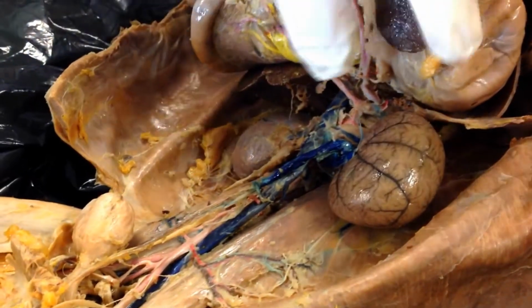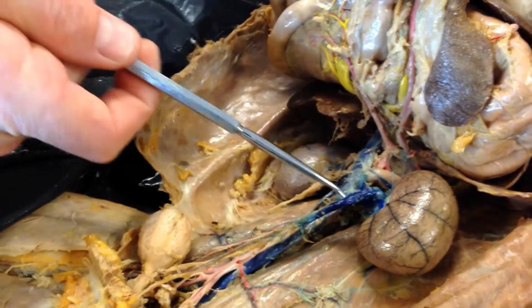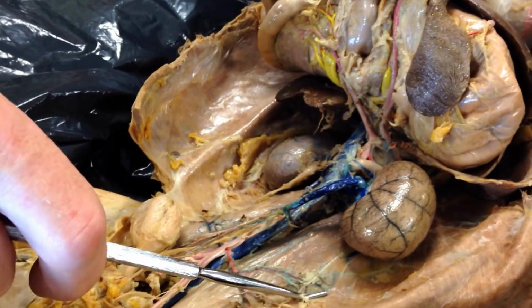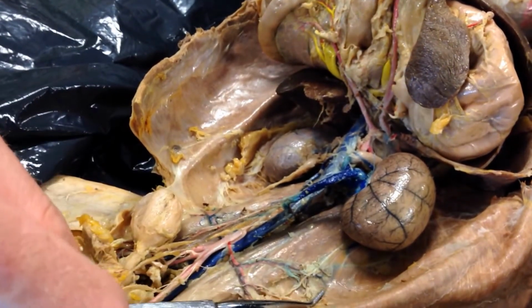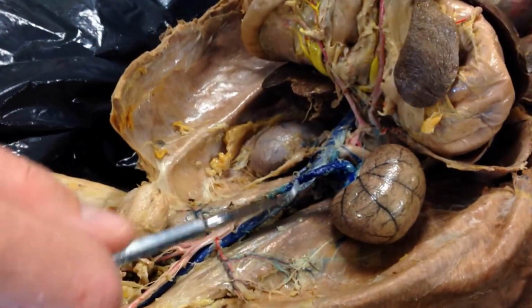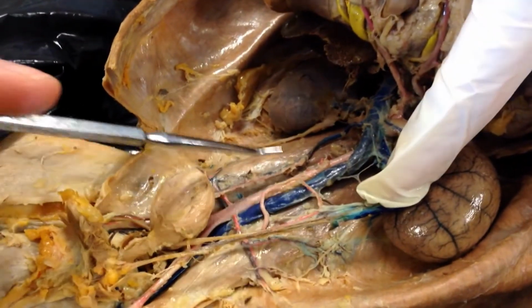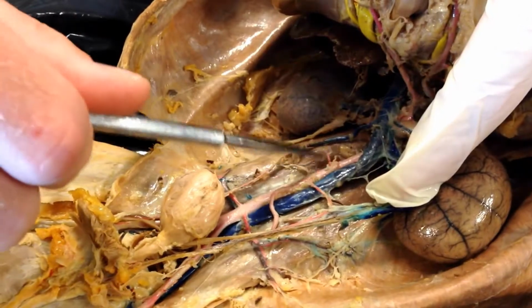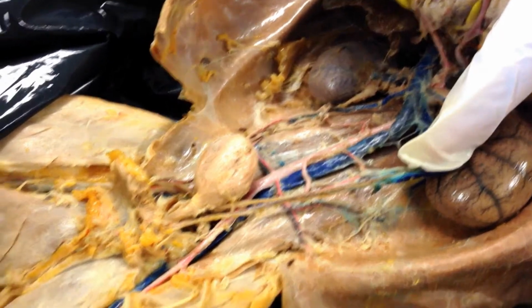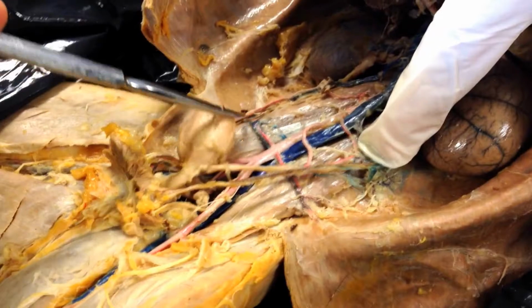The next one down would be the genital. So the genital veins, remember, come off way up high. Remember, they do this because everybody starts off with the testes that are way down at the end here. They start off kind of as ovaries until testosterone is produced, so they usually go right out here to the ovaries, and then those arteries and veins have to grow along with it. So the blue is the vein, but the artery comes off this aorta right here, and the other side comes off right here, and then they join up with the vein and they run all the way down to the testicles.